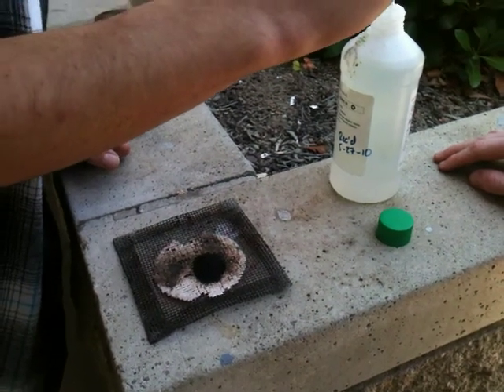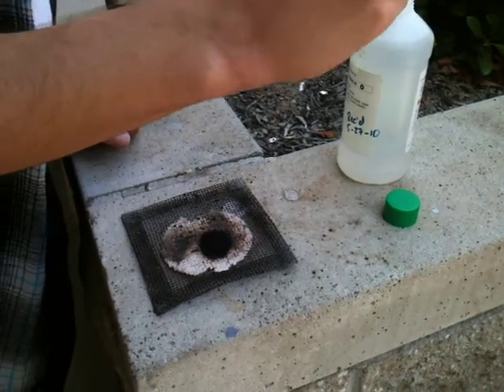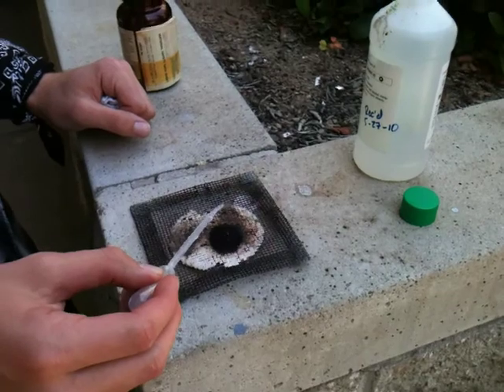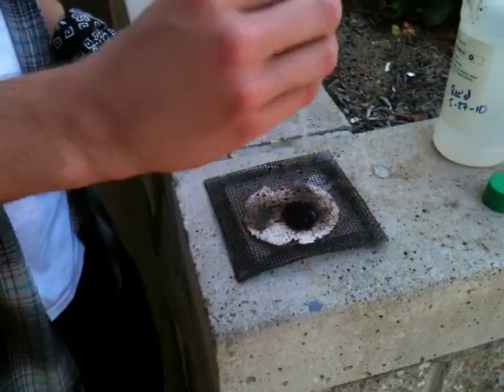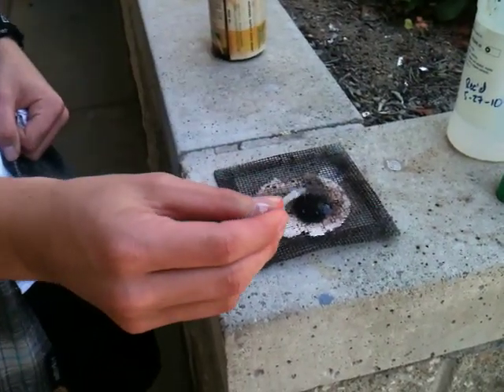So what is this reaction? Potassium permanganate and glycerin. Okay, and what's it form? Purple flame. It forms carbon dioxide and water. And then, what are the other two? I forgot the other two. Go, that's gonna ignite and go straight into your arm. I know.